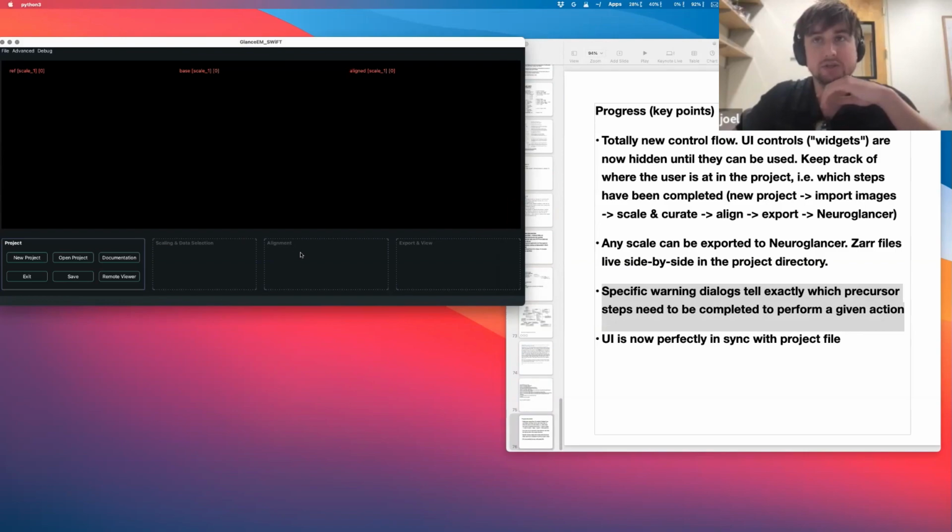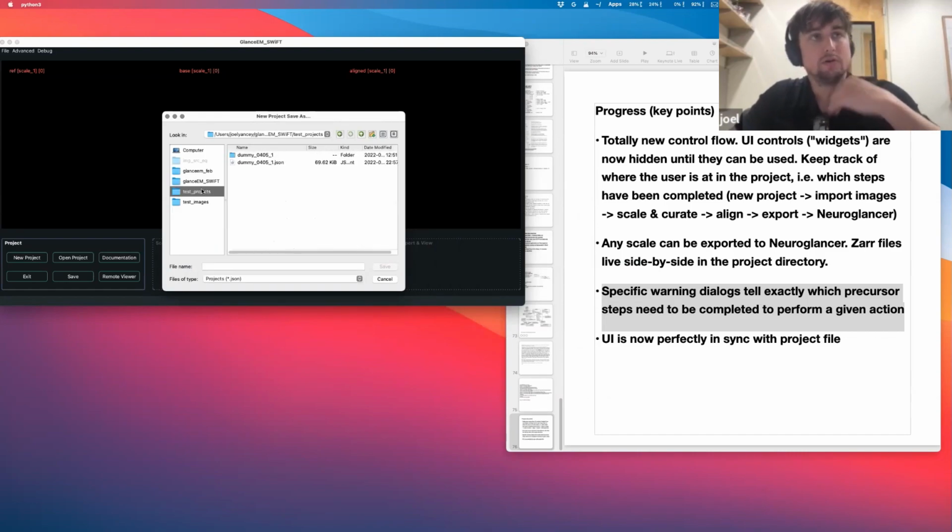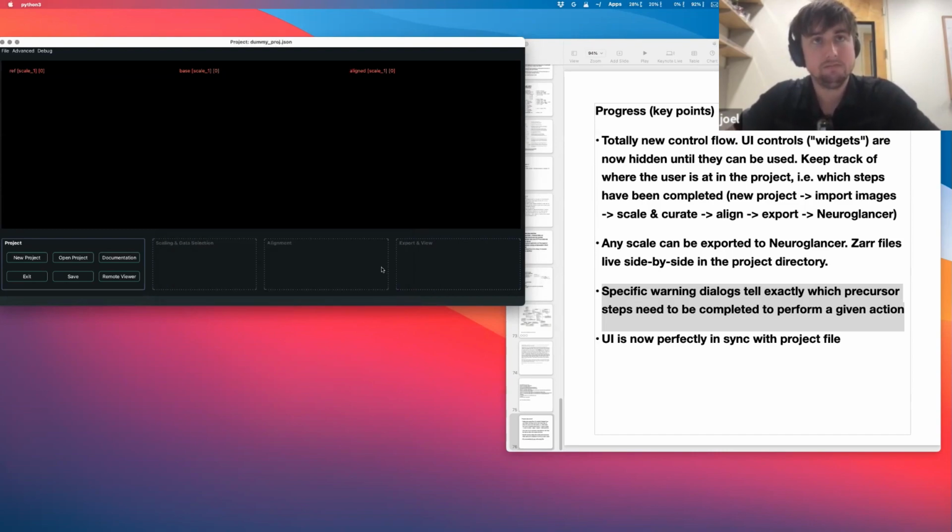So let me just show you. I'll do a project from beginning to end. When I go new project, it's gonna give me a new project save as window. So I'll just go into test projects. Just go. And then this is going to be our project file. And so you see that the scaling and data selection lights up here. And now we can use those controls.